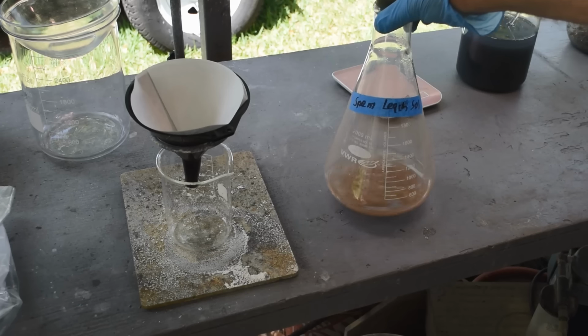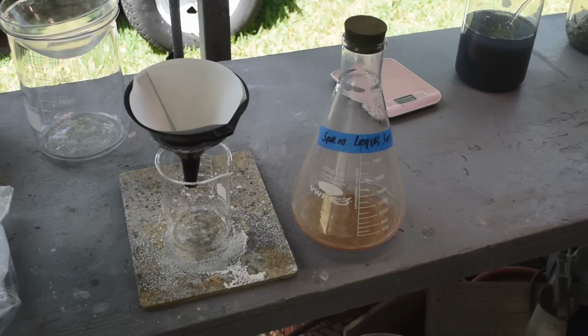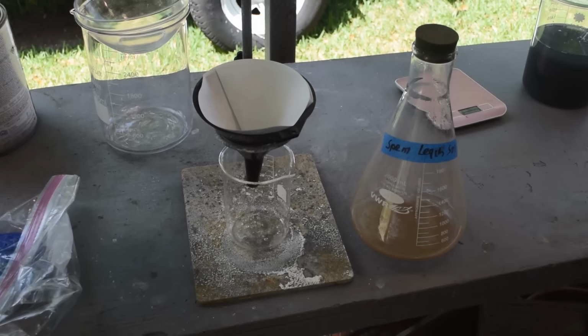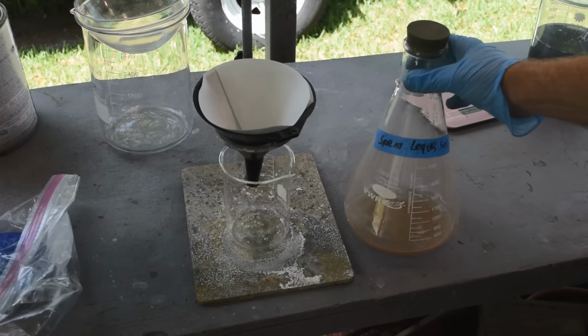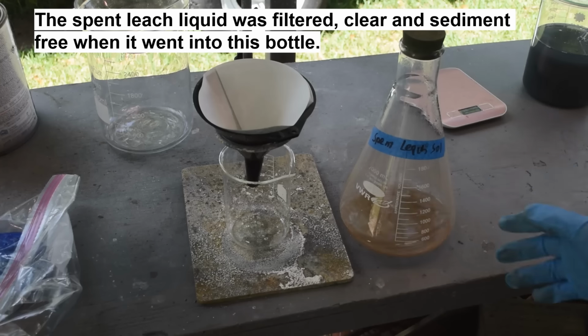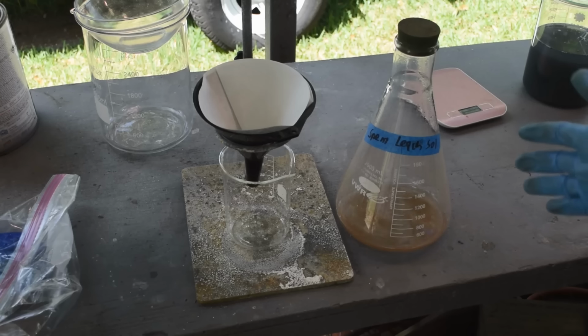Now, this is my spent leach bottle. I've been experimenting, doing stuff in the background, working off camera, trying to figure this out. There's a sediment in the bottom of my spent leach bottle. It doesn't really look like gold, but what if it is gold? What if some of the gold is staying in the spent leach and then precipitating out later, over time? It took the better part of 2 weeks for all this stuff to precipitate out, whatever it is.